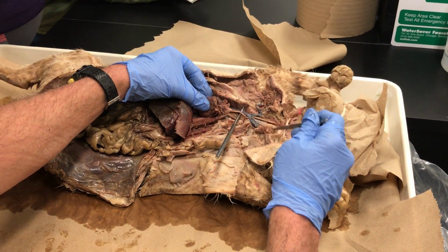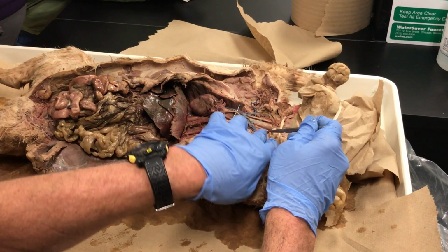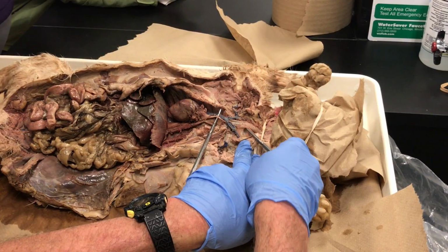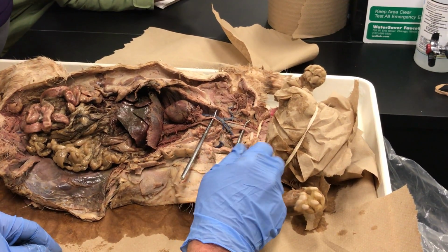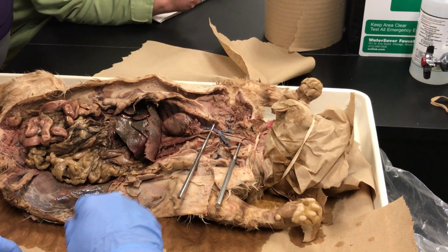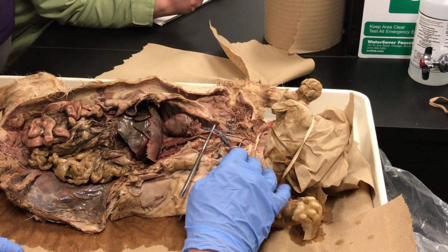That pink pipe, if we follow it, goes underneath this blue tube. This is the windpipe, by the way, parallels the windpipe to this vessel, and that is an external or common carotid artery, a common carotid. So the first branch off of the brachiocephalic is called the common carotid.